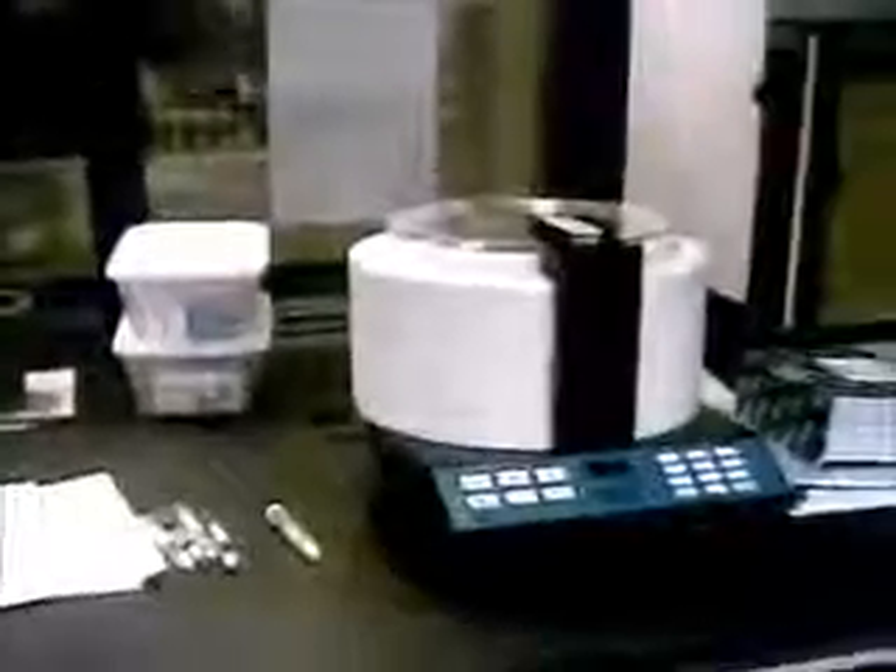These instructions apply to this centrifuge only. Before you actually start, you need to get 15 milliliter test tubes in which you shall prepare your solution, which can be found in the drawer right opposite to it, as shown here. These are in styrofoam containers and are placed upright. For a demonstration, I shall use trial test tubes over there, which have been prepared and filled with water.